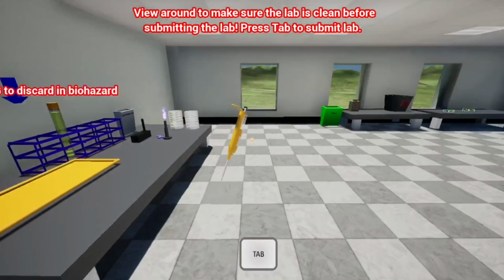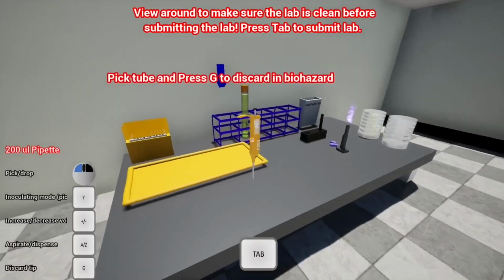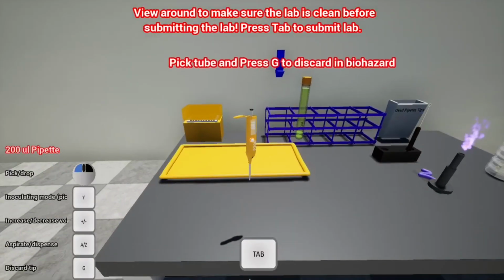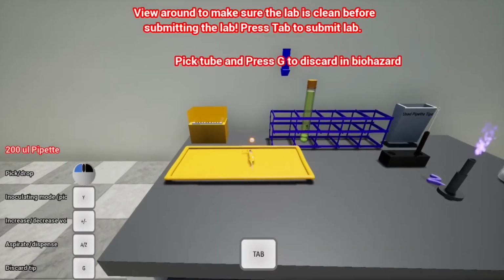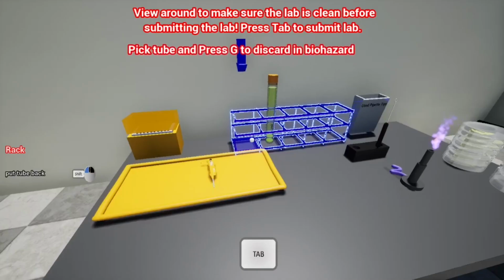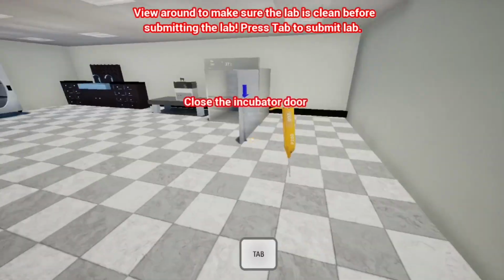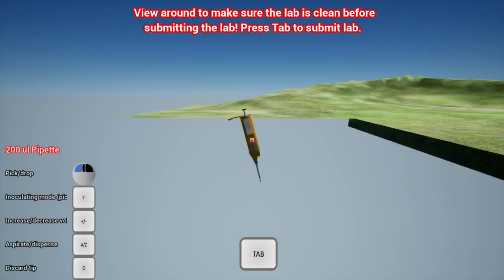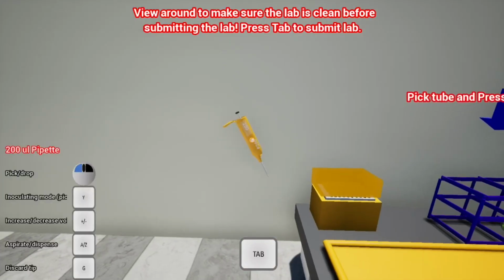So these are just glitches, because again, no real computer software is perfect, but try to identify all the glitches there are, and try to get around those. So again, if something gets stuck, it's not moving at all, you can always use the right click to force it back.